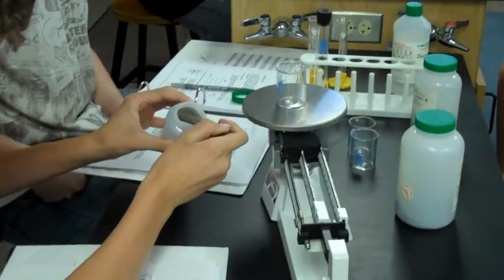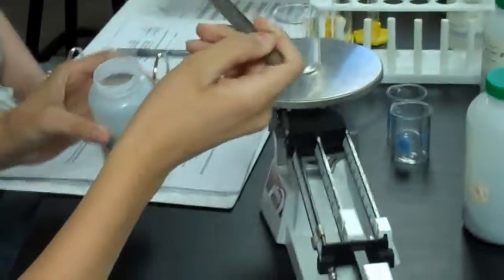Okay, now very carefully, because they're tiny little lead balls, it's lead shot. They roll a lot. This is pure. Okay, so very carefully get some of it out. That doesn't mean reach in with your finger. We've got a scoop. And you need to go straight from there into the beaker so we don't lose any of it. And you actually have to get some on the scoop. I told you, very carefully.